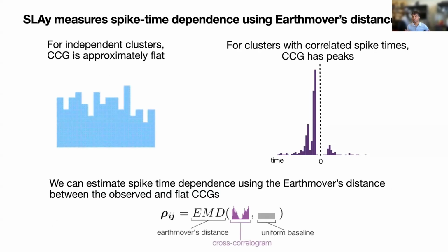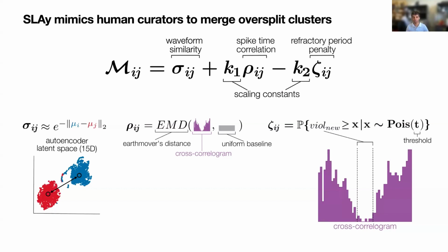And then the idea behind the cross-correlation metric is that for independent clusters, their cross-correlogram should be approximately flat. And for clusters with correlated spike times, the cross-correlogram should be very non-uniform. So this is an example of a cross-correlogram from an oversplit bursting unit where you can see this very characteristic asymmetric shape with a very large peak. So to quantify how far this observed cross-correlogram is from an independent distribution, we use the Earth mover's distance, which is essentially just a way to compare different distributions. So that makes up our second metric for spike time correlation.